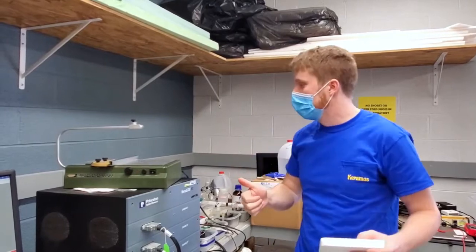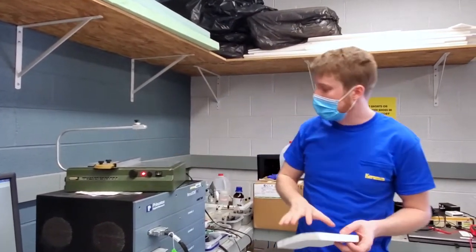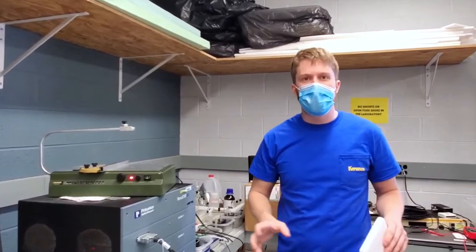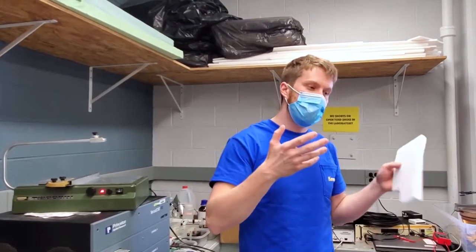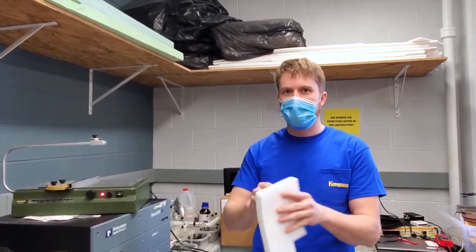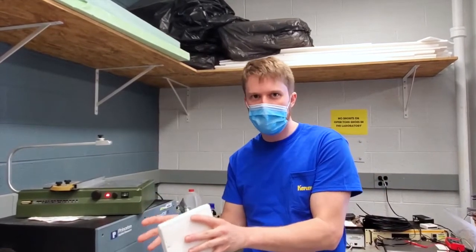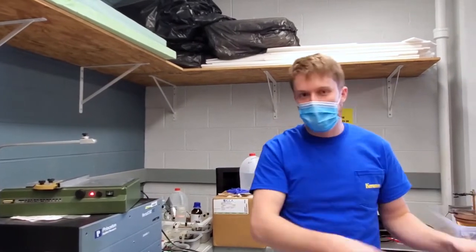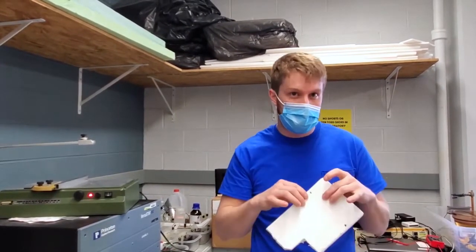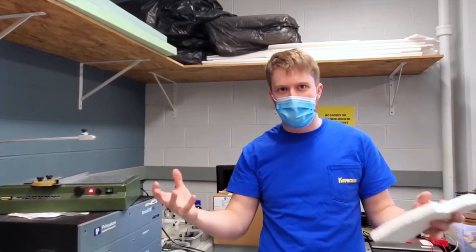So another cool thing in here is actually these foam cutters that are basically a heated piece of wire. So when you're making something called investment casting for casting metals, you basically make the structure out of a foam or a wax that you want your final cast object to be, and then you build a plaster mold around that, and then you can burn out the inside piece of foam or wax or whatever it is, and then cast into that opening, and the opening will be the shape that you came up with.